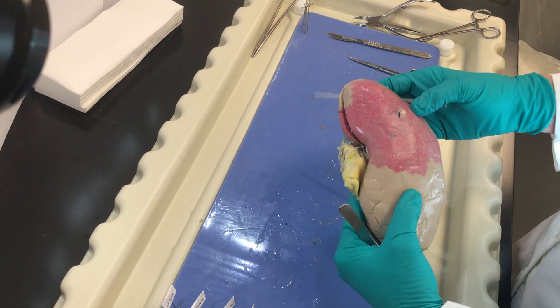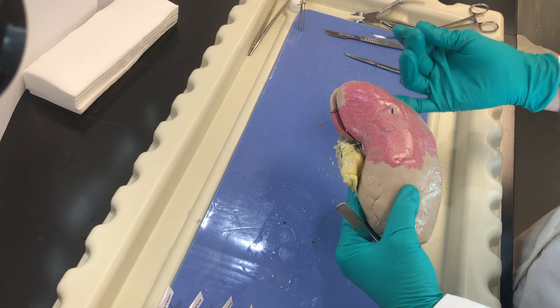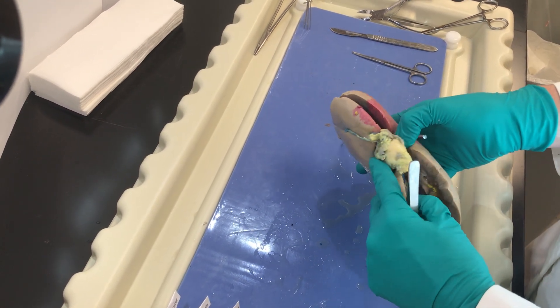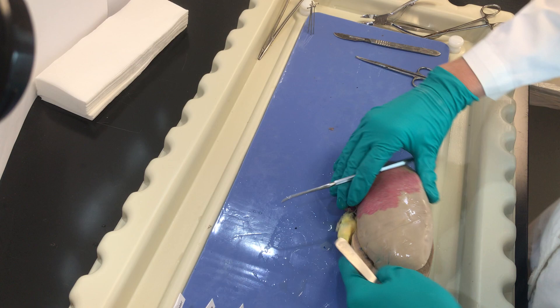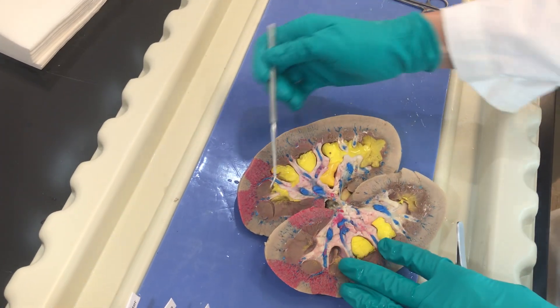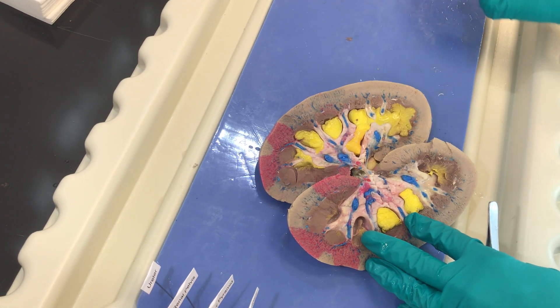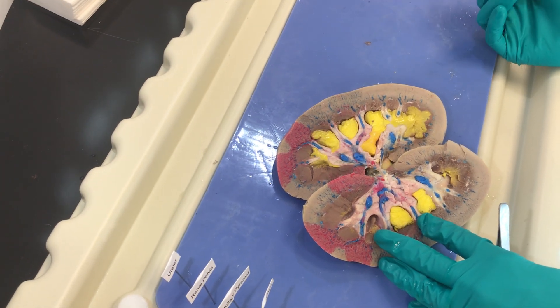Now this kidney has been injected with latex to allow you to see the vessels within the kidney. So I'm going to orient you here — this is my sagittal section of the kidney, and there are some important structures we want to point out.